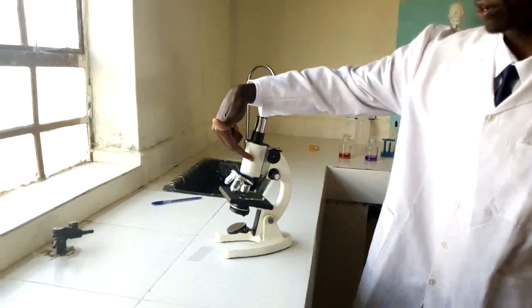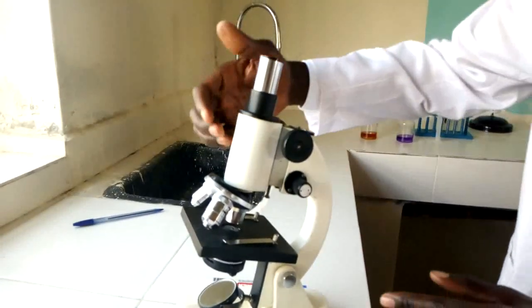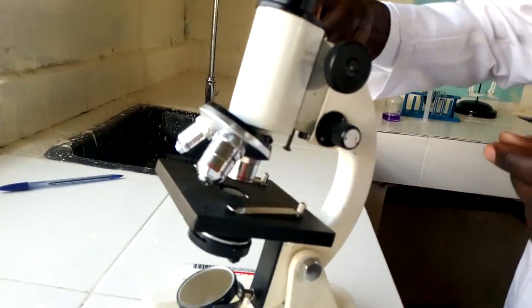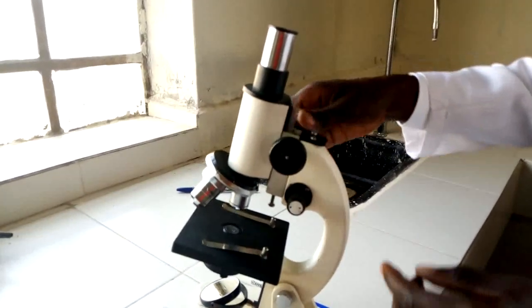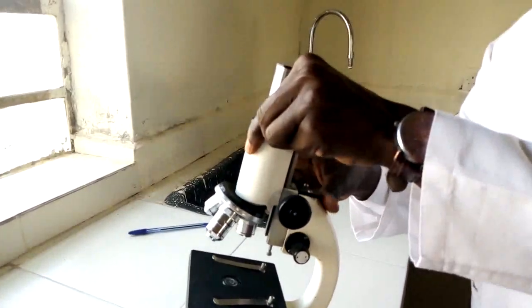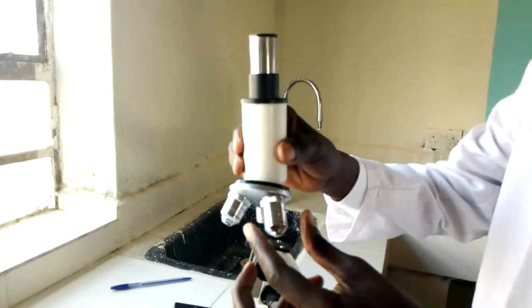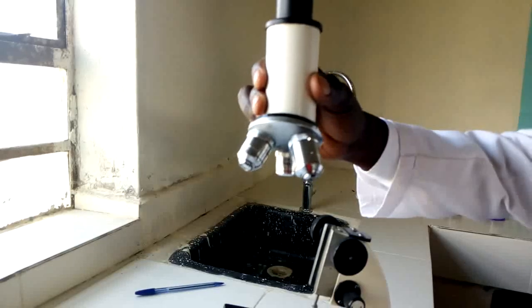It also contains another part referred to as the body tube. The body tube — this white part here — comprises some regions which enable it to hold on to the objective lenses. I'm going to use the coarse adjustment knob to move the body tube up and down. The body tube has an important function of holding the eyepiece and the revolving nosepiece into position.